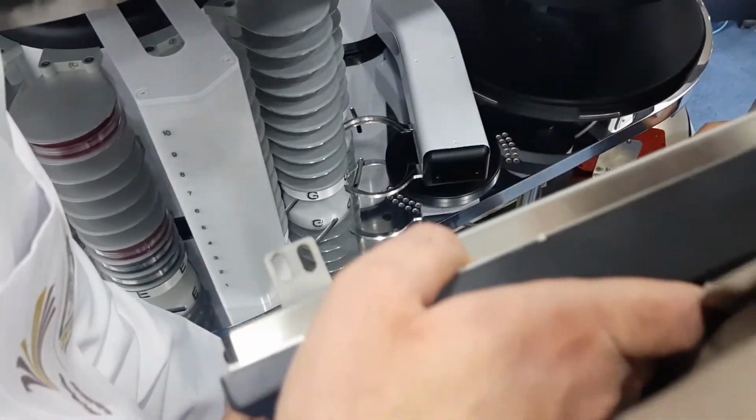It's already directed. Right? Okay. So yeah, I have to align it on the top too. Be careful of the top. It fits. You pull a little bit up. Yeah. Okay, good. Adjust it. Yeah. That's good. Let's go on the top. Push. Looks okay.